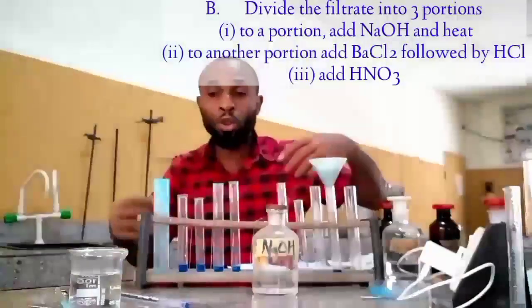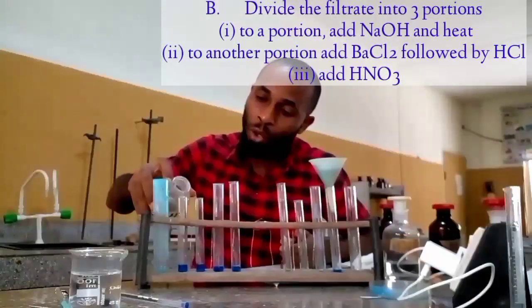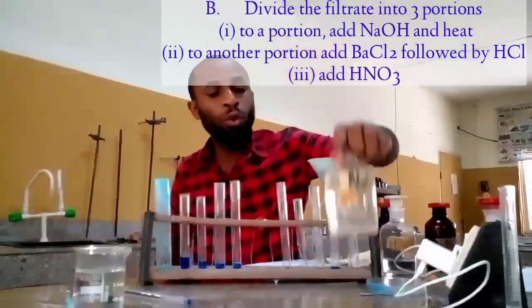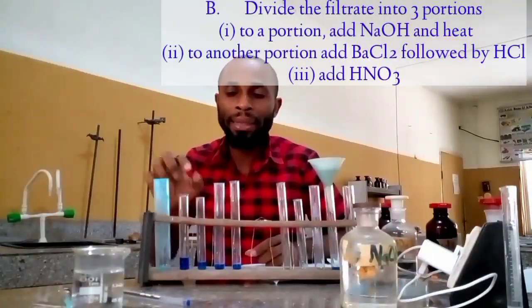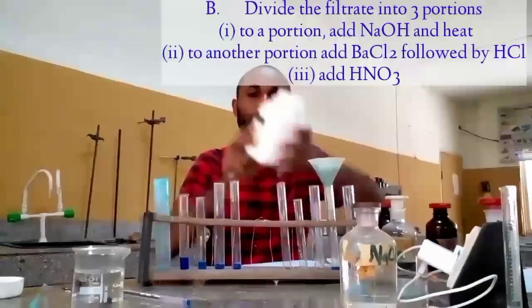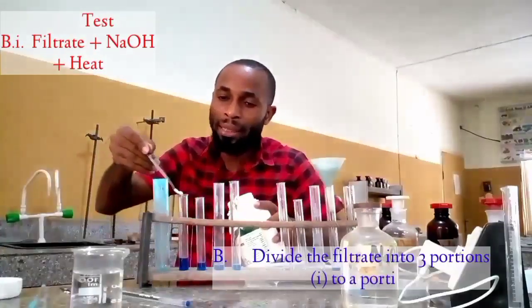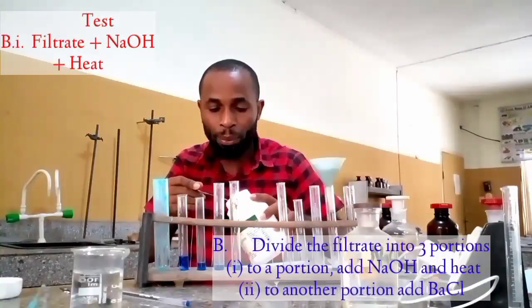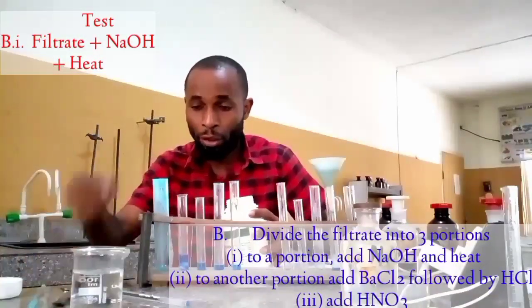They ask that I add it in drops and heat. I am not going to heat, as I said. What I'm going to do is introduce some of my sodium hydroxide pellet inside this. We are going to watch what will happen. The reason why I'm using this rather than heat is because it's a simple idea: this thing is an exothermic reaction when it dissolves in water. Let's see the possible thing we are going to notice if, for instance, they ask us to heat this.